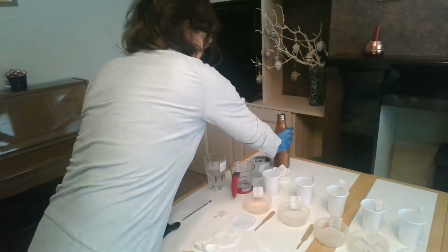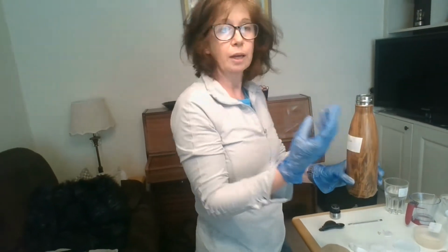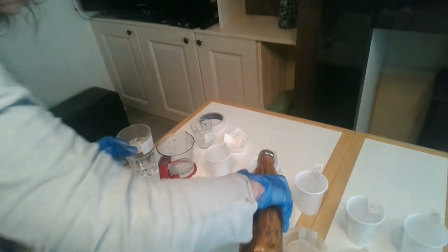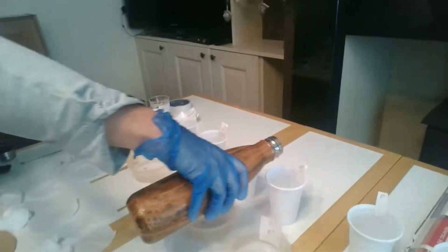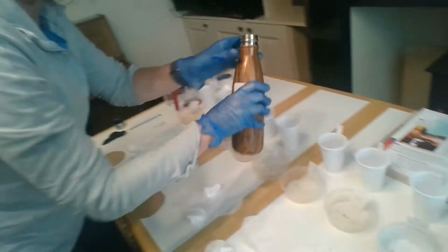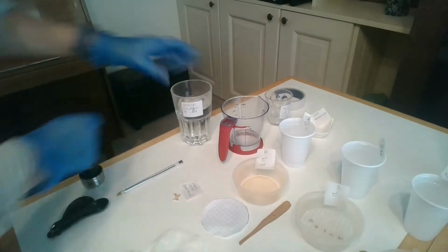To get going, and just go with me on this one, again, you're going to use either a pipette or a graduated cylinder, and you're going to put 9 mils of water into each of these. So 9 mils of distilled water, just imagine I'm measuring it really accurately, goes into the bottles A, B, C, D, E, F, including G. So we now have 9 mils of water into all of these, and in this one I have 10 mils of my stock solution of IAA.